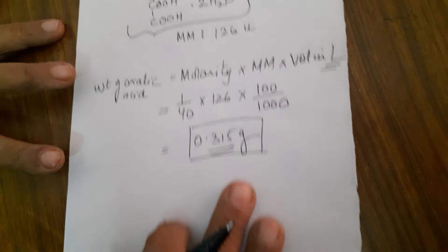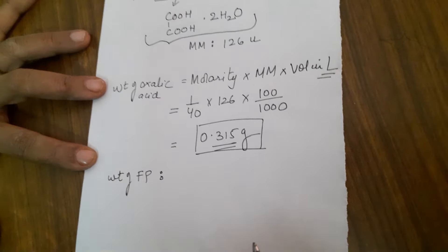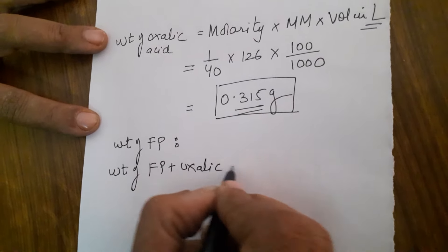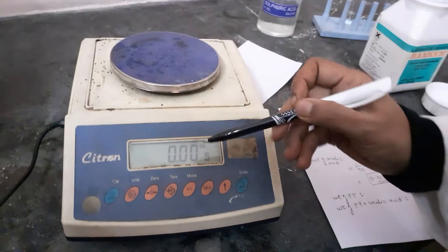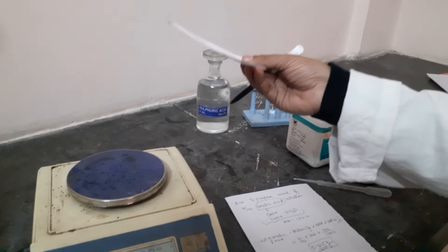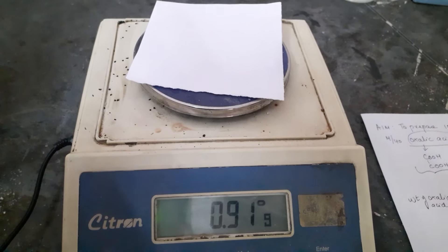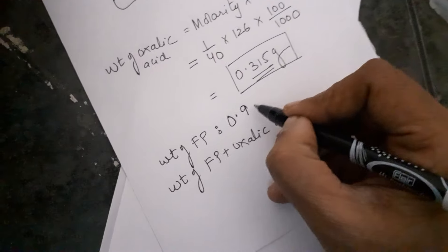Now, for weighing you need the weight of the filter paper — or any paper — and then the weight of filter paper plus oxalic acid. Let us move to the digital balance. This is my digital balance. Before you begin, please check that it reads 0.00. I am using a piece of paper for weighing; you can also use a round cut filter paper or a watch glass. The weight of this filter paper is 0.91 grams.